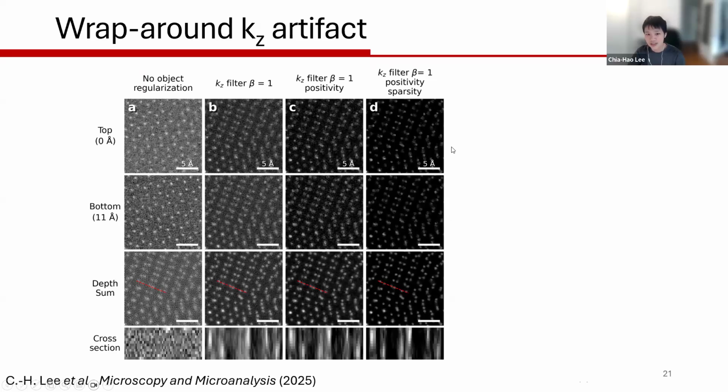But I just want to pay attention here. If you use a typical parameter for multi-layer regularization, with a parameter equal to 1 in, for example, fold_slice, and you try this on this twisted bilayer WSe2 data set, you actually see that the top layer and the bottom layer look pretty much the same. Fundamentally, that is because there's this wraparound behavior for Fourier transforming a finite signal. The top layer and the bottom layer are actually coupled together because we are doing the inverse Fourier transform to get the final object back.